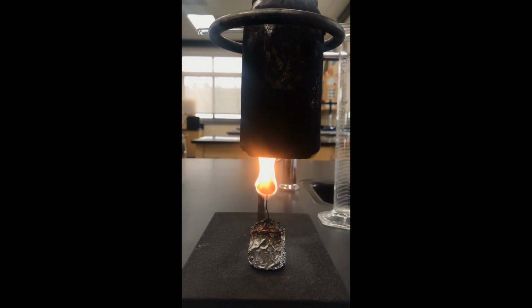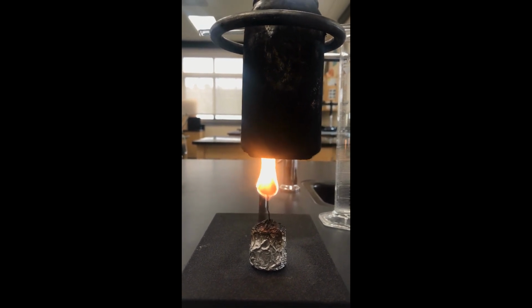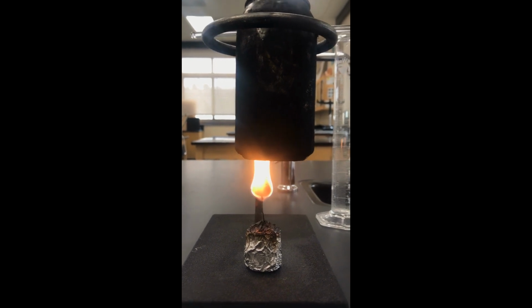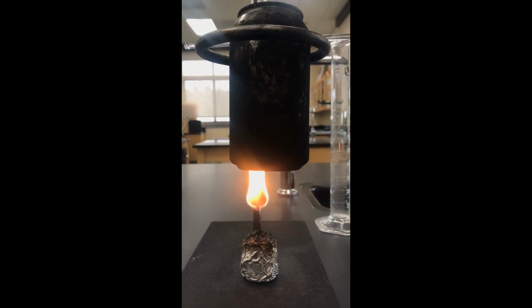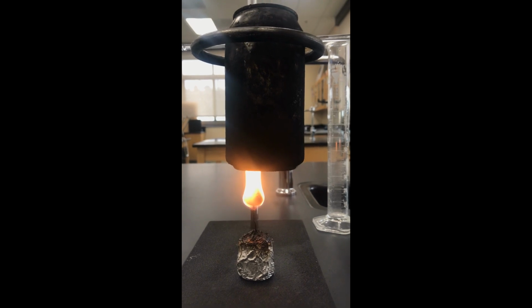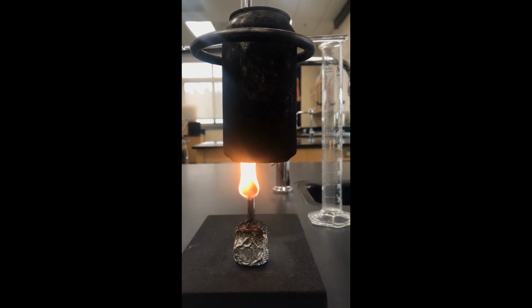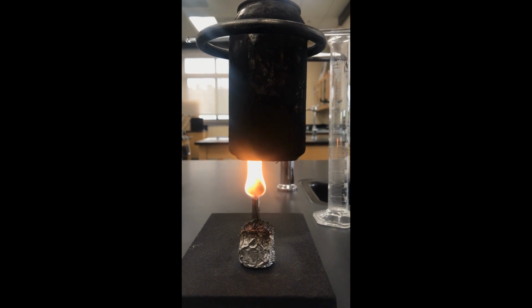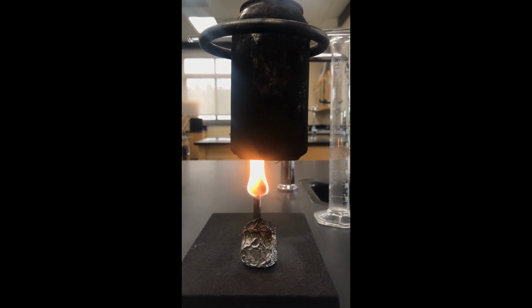The thing about doing this digitally is that anyone with a peanut allergy does not have to be excluded from this experiment. And we don't have to change our food items. For that, again, the opposite of our marshmallow, we're glad there is no smell-o-vision here.